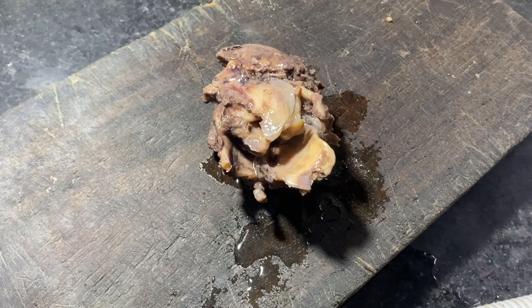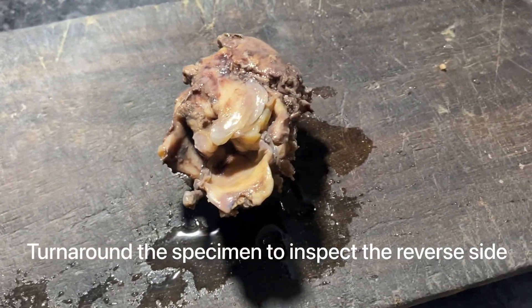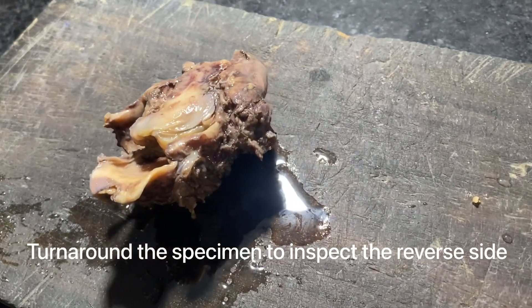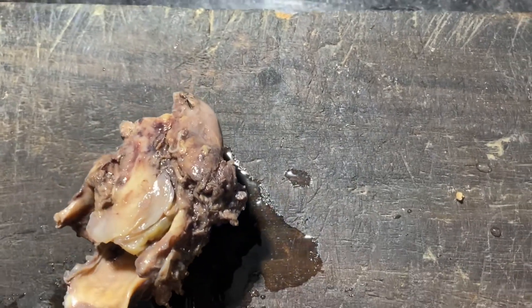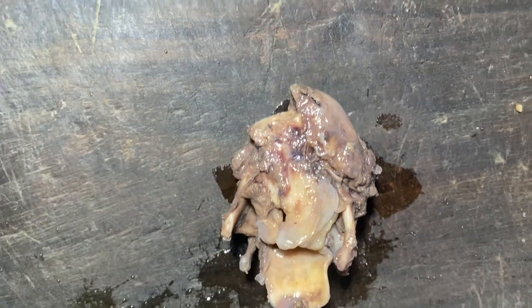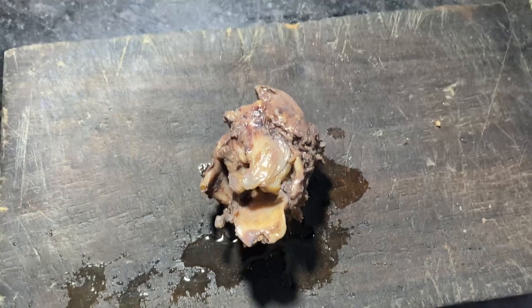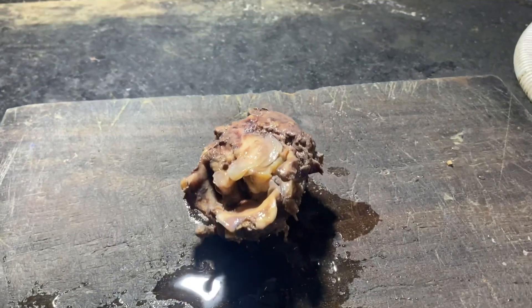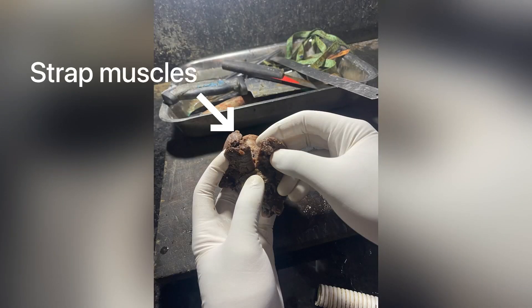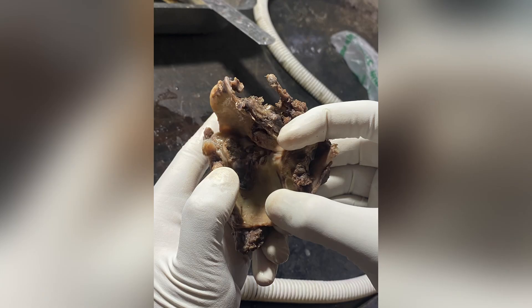Next, we will have to take a look at the different landmarks of the specimen such as the trachea, the hyoid bone, the thyroid gland, the strap muscles, and so on. Next, we have to try to orient the specimen by looking at the different landmarks.